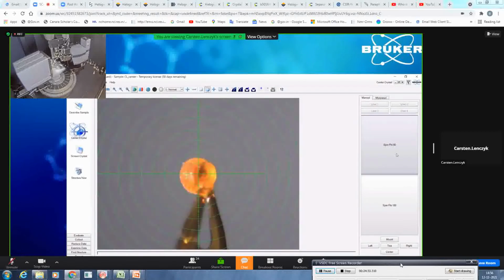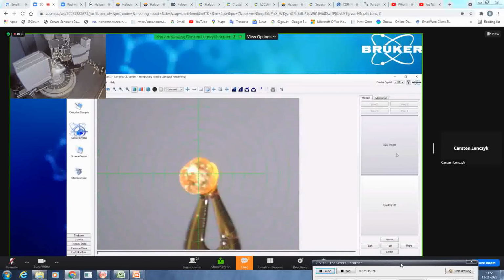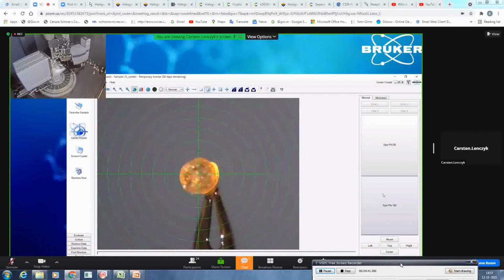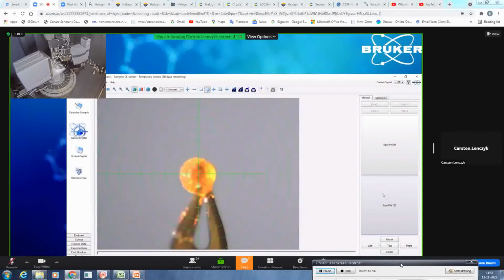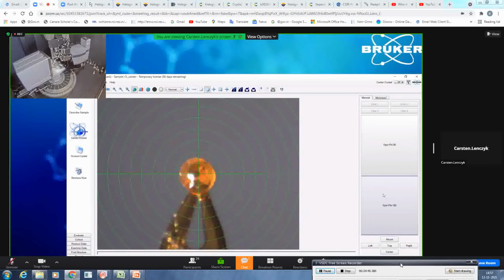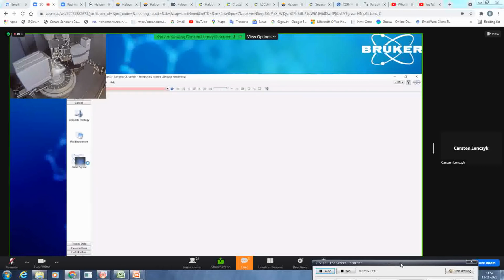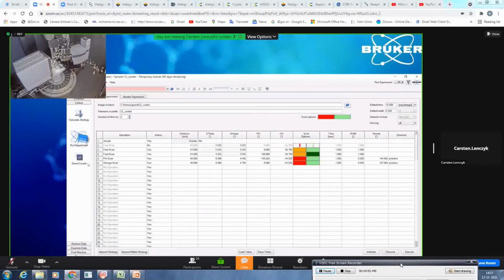So you just go here and do once again 180 degrees. And you see that it is now perfectly centered. So we close this plugin. And what we will then do is we will start with the fast scan. I will close the door.